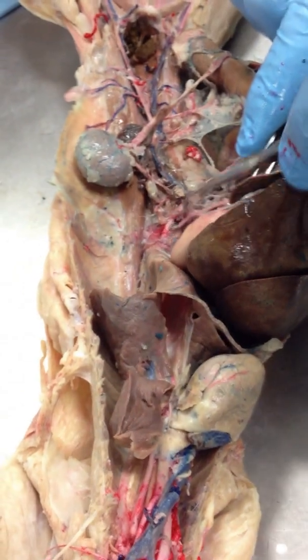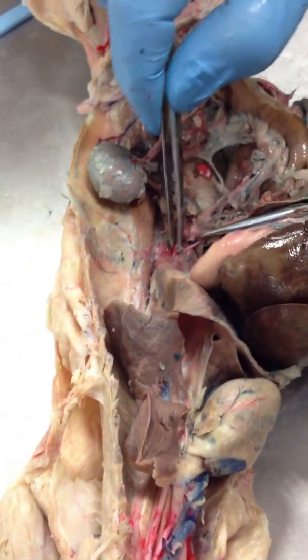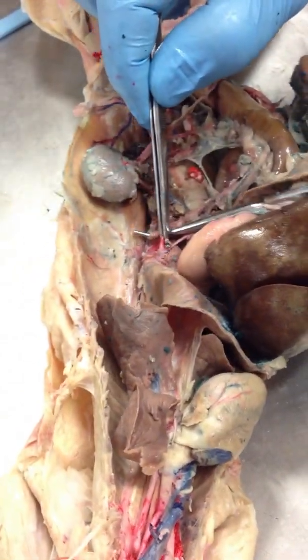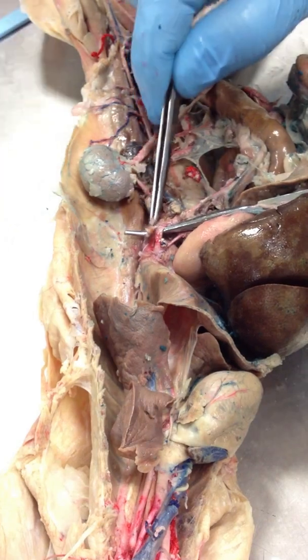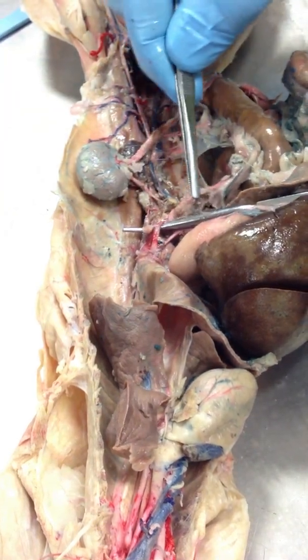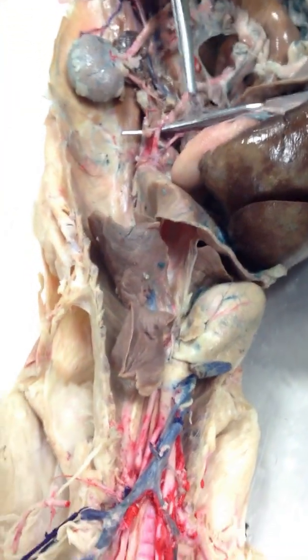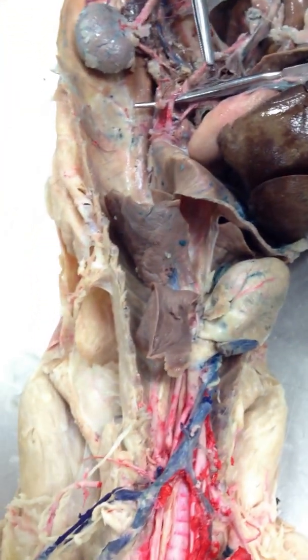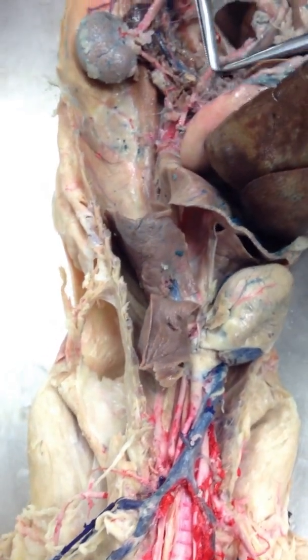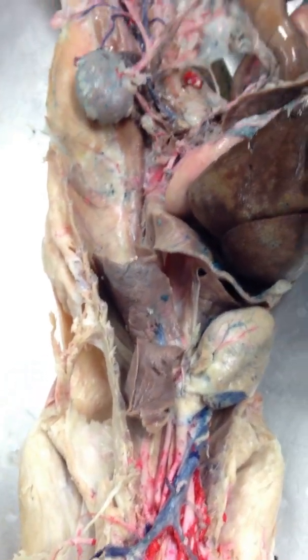If we go back now to the descending abdominal aorta, which is right here, we're going to have another branch right here. This is the anterior mesenteric artery. This is supplying blood to the intestines.